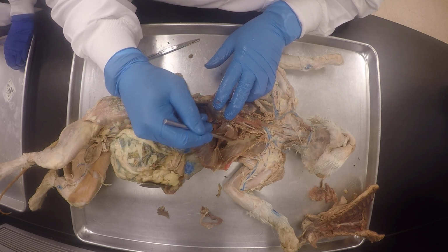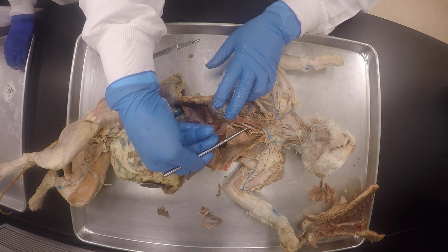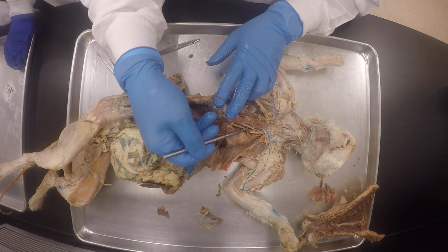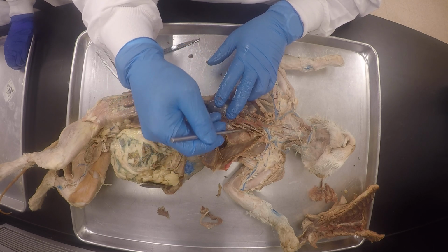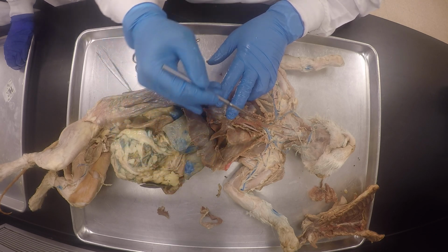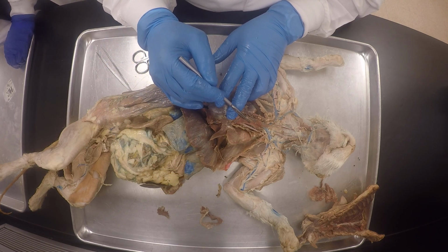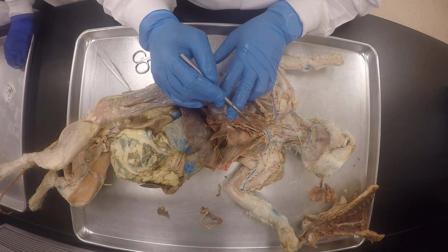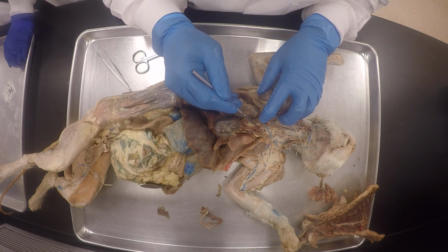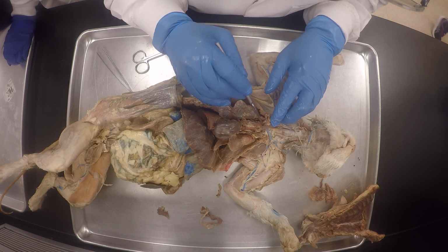Yeah, coming. It's kind of not that red, huh? It's kind of pink. It's kind of because it was covered mostly by the connective tissue, which is whitish, and now that I've removed the connective tissue and the excess, you see, it's a little bit more red. Okay. So there's the brachiocephalic trunk. You see what I told you? In the cat, the brachiocephalic trunk will give rise to the left and right common carotid. That's where it separates.